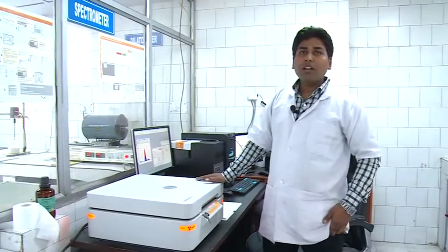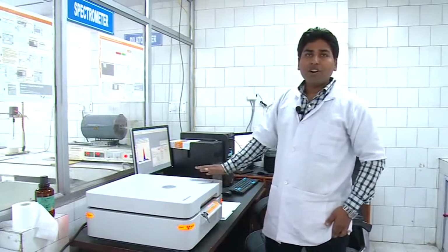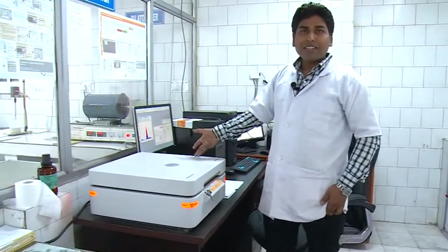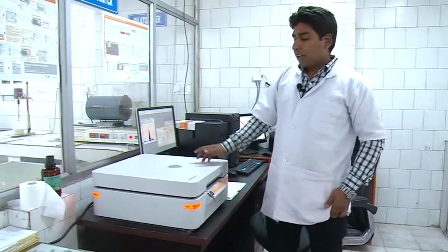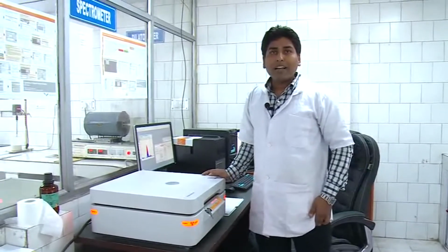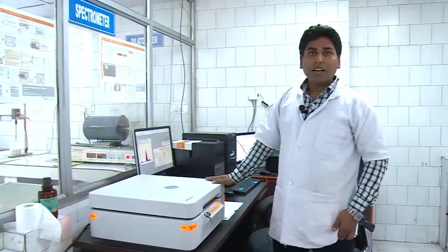My name is Vikas Gaur and I am working on the X-ray fluorescence spectrometer, in short XRF spectrometer. The spectrometer is equipped with the facility to carry out chemical analysis of major and minor compounds like Na2O, P2O5, SO3, TiO2, CaO, MgO, MnO, including solid, pressed and loose powder. We prepare pressed pellet samples for chemical analysis.